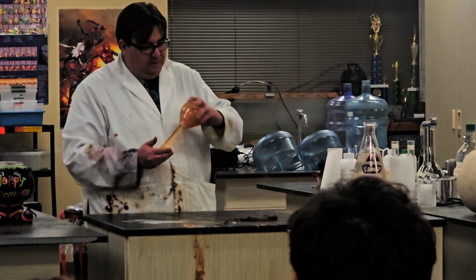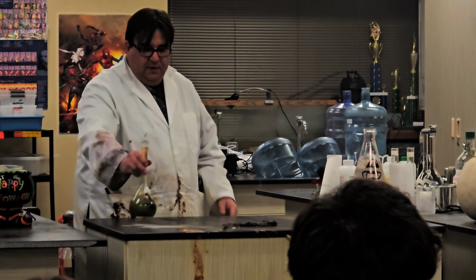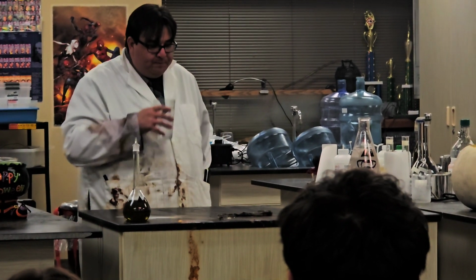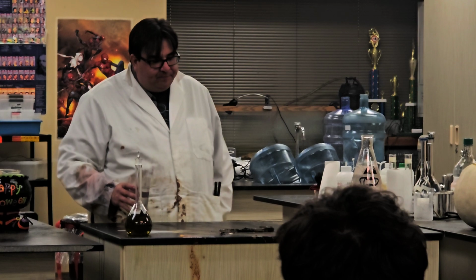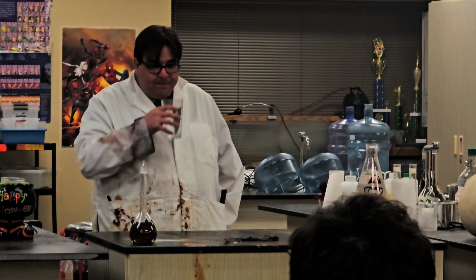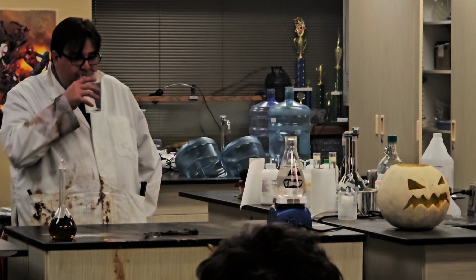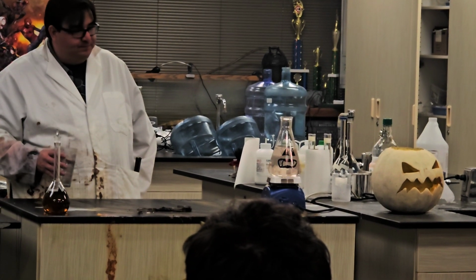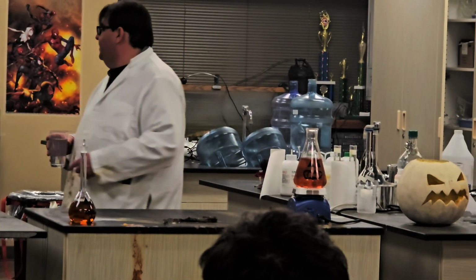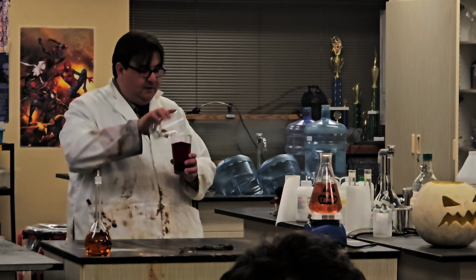And get this little guy to go back again. I've been talking a lot, man. I need to hydrate. Hey, see, now he's a ghost again. That one's kind of changing back a little bit. Oh, look, he's going. That one's going too. While we watch this, the water's just not doing it for me, so I'm gonna take some Kool-Aid really quick.